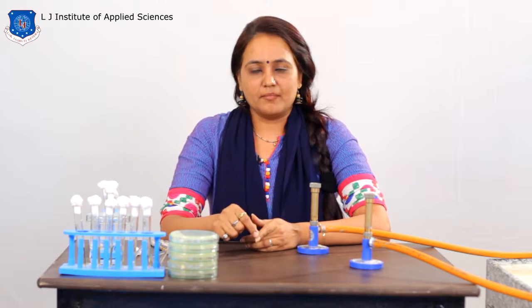Dear students, today our aim of the practical is to study the ecological diversity of the bacteria. As we know, ecological diversity is part of biological diversity. Now, ecological diversity is actually based on the bacterial requirement. Requirements are generally of two types. The first is nutritional requirement, and the second one is physiological requirement.